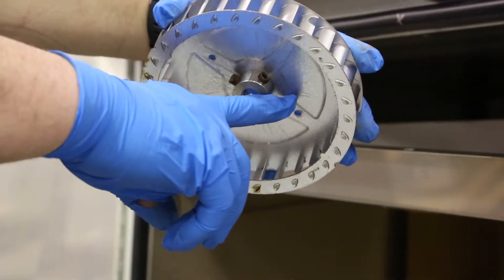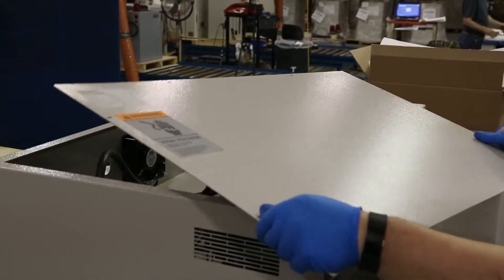Here you can see the set screws. To access the motor, remove the top cover.